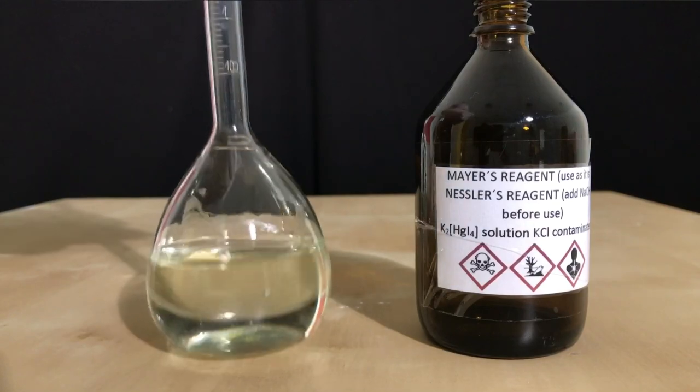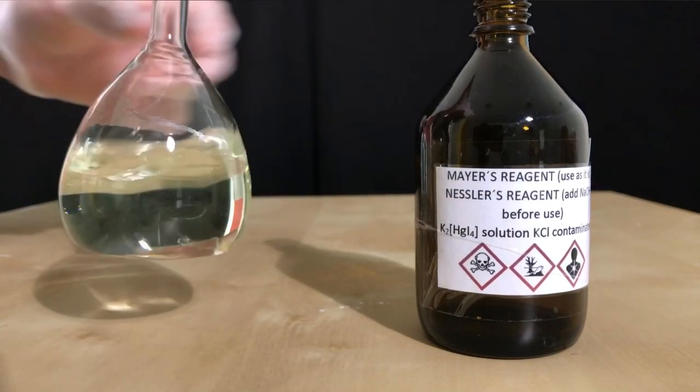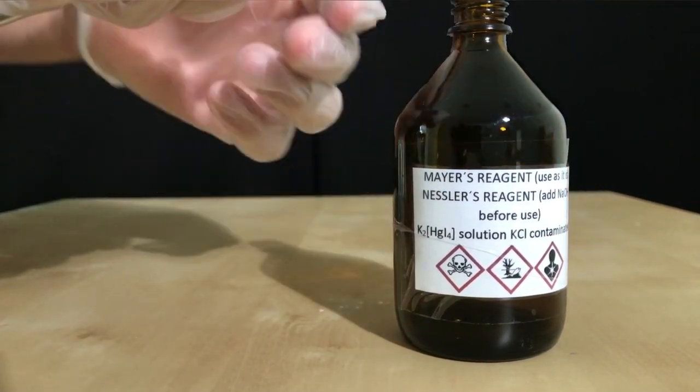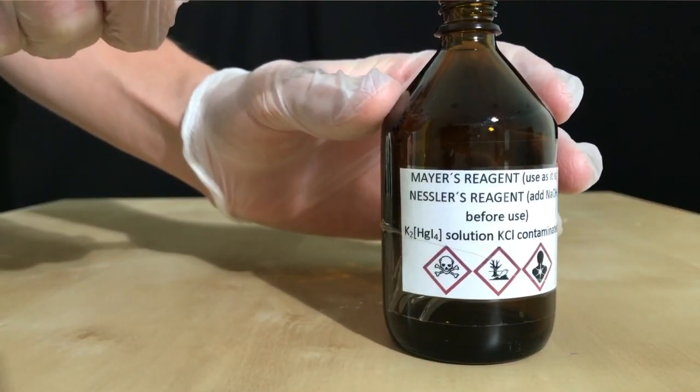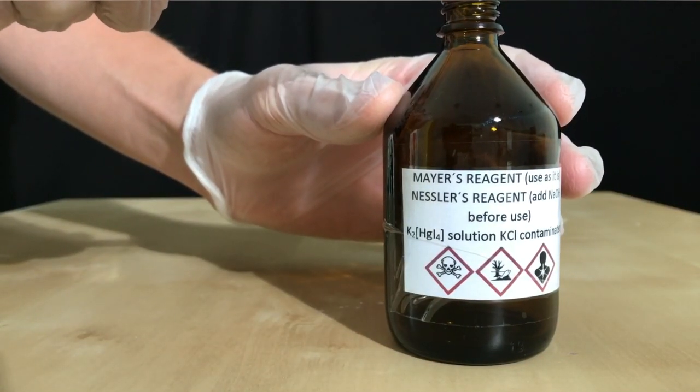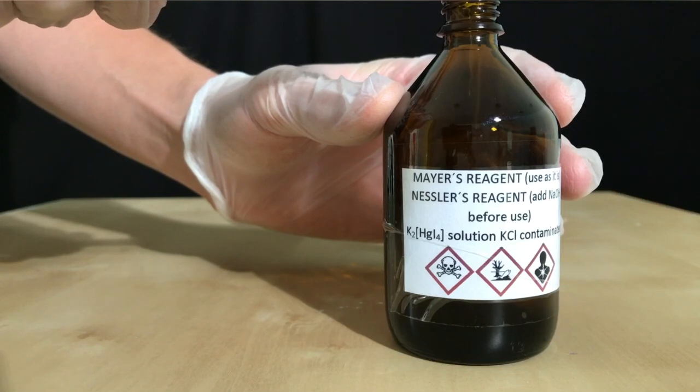The solution was then transferred to a suitable storage bottle which was then filled up to the 100ml mark. Yes, I could have filled up the volumetric flask to the 100ml mark but I decided to go this way because I didn't want to rinse it back.